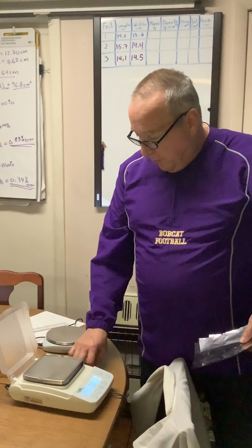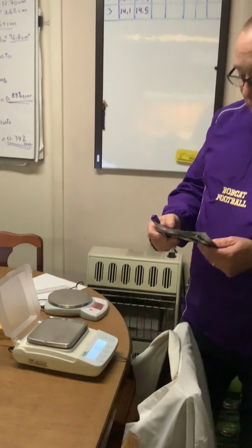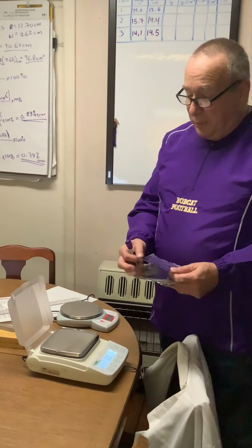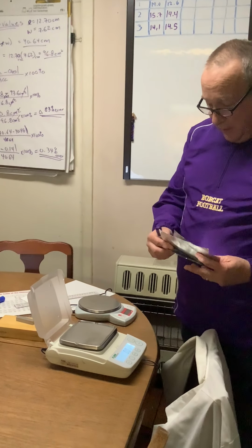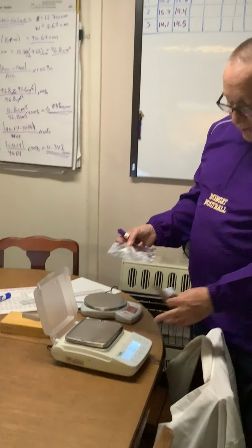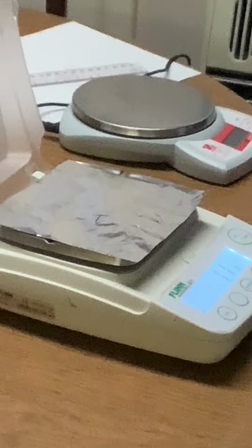This is one balance. These are both accurate to 1/10 of a gram. We have others in the lab that are accurate to 1/100 of a gram. Those are the ones I meant to bring home, but I brought home the wrong one. But let me just weigh these because I think this will be accurate enough for us. Perhaps you can zoom in on the balance numbers, but this is foil number 1.